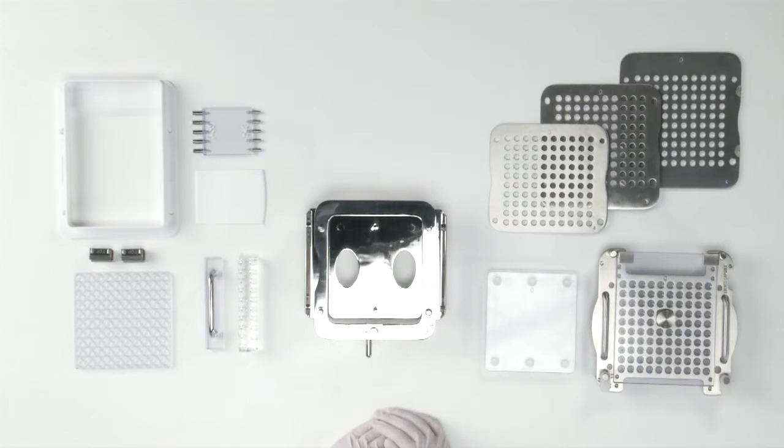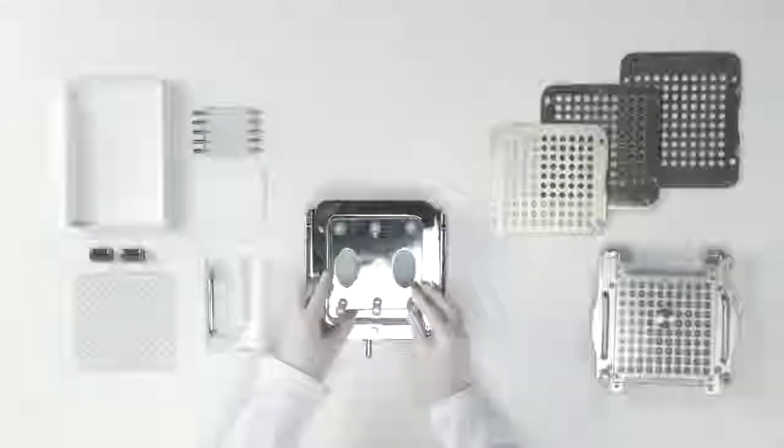We are now going to assemble the CapsiCards machine. Place the spacer plate in the filler base.